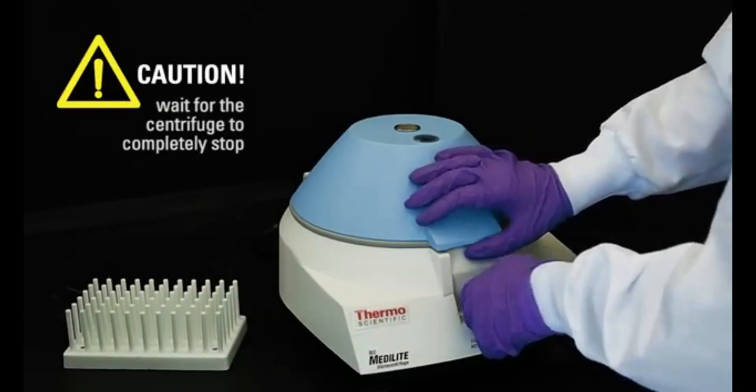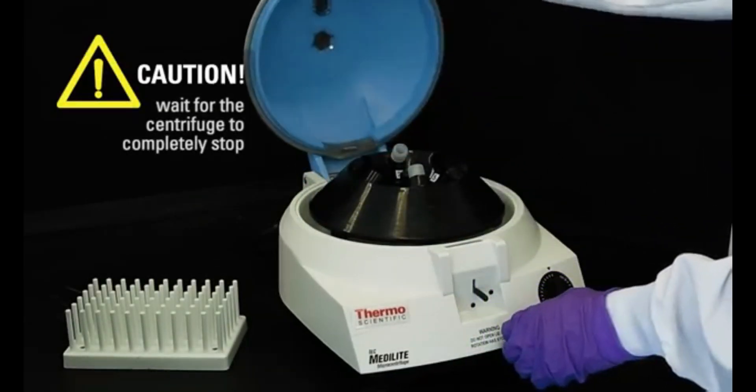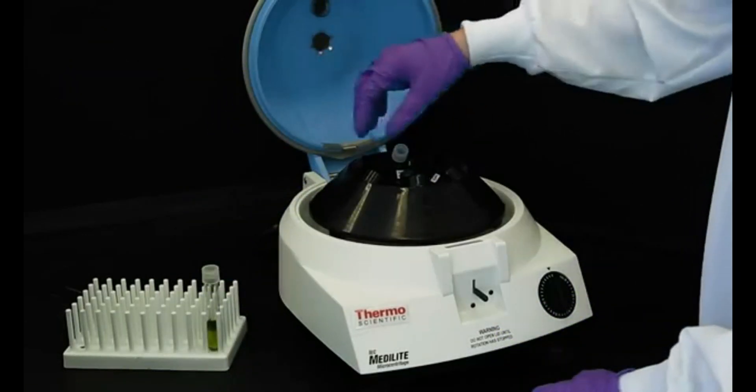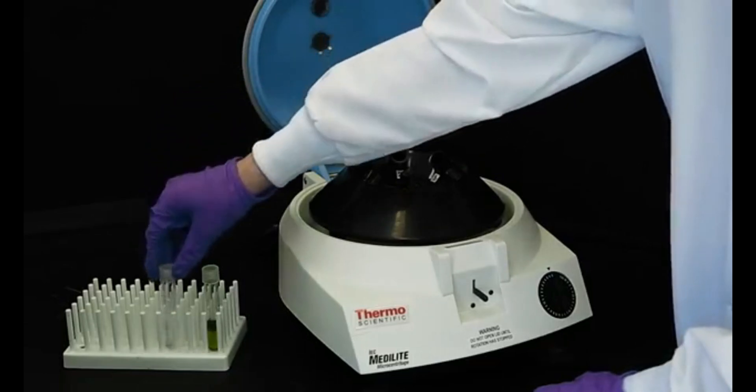Do not open the lid until the centrifuge has come to a complete stop. Remove samples from the centrifuge. Identify each sample based on its recorded position number.